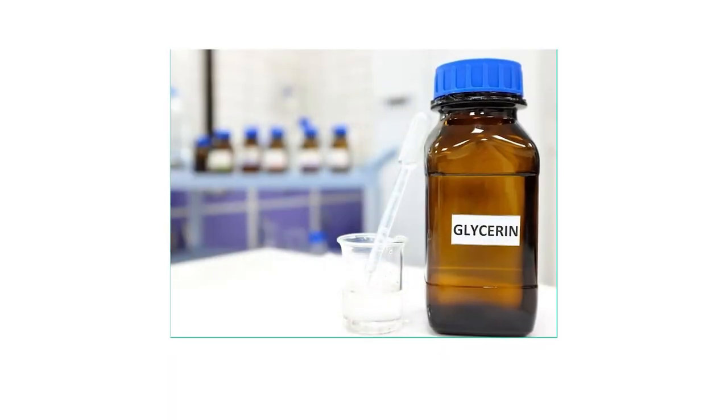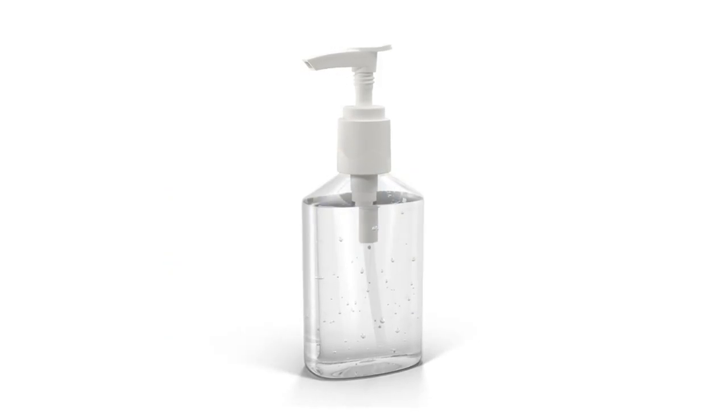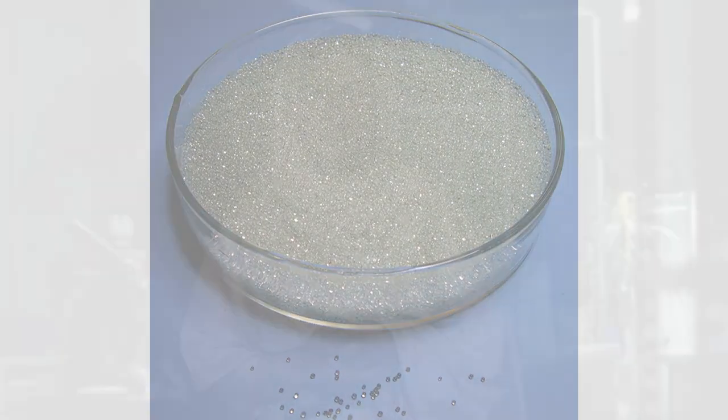There are different types of tools and equipment we can use for taxonomic identification and classification. We can use liquid media like glycerin, jelly-like materials such as sanitizer, white sand, or beads. We can also use different shapes like a dome shape to set the specimen. There are two main types of specimens: dry specimens and wet specimens.